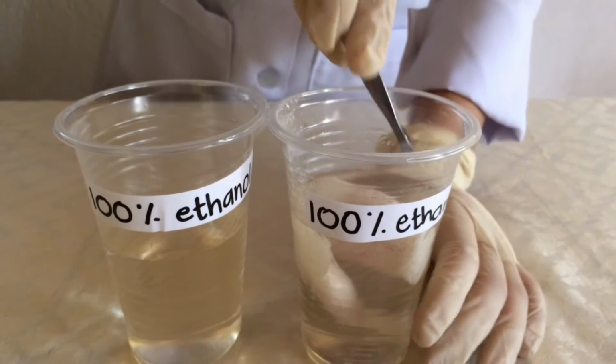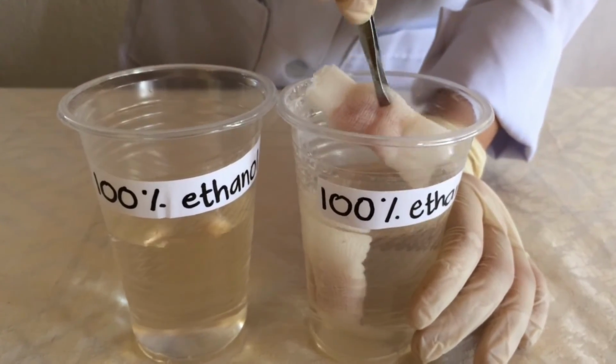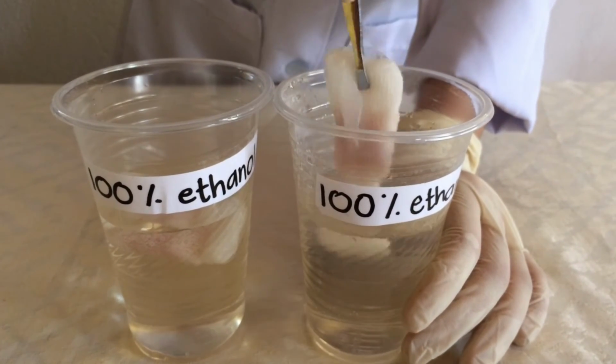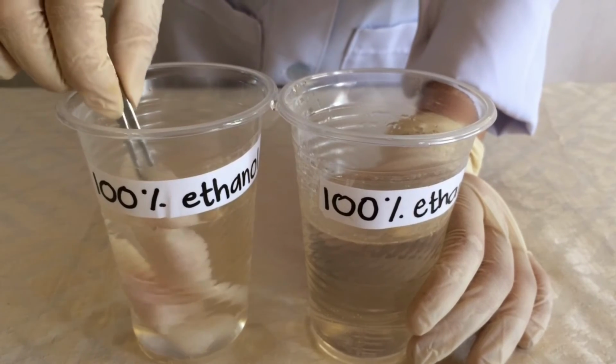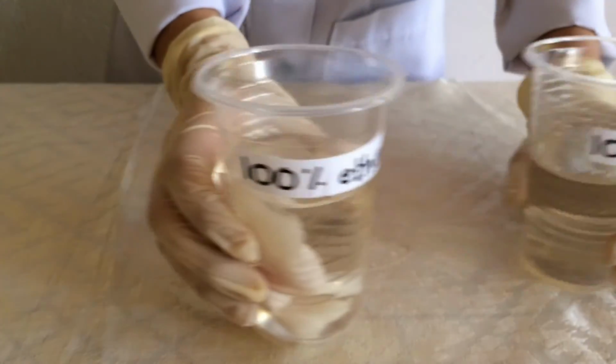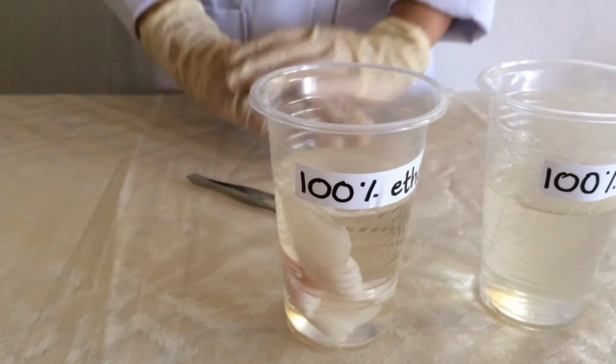After 30 minutes, let's transfer our sample in another 100% ethanol and leave it for 45 minutes.